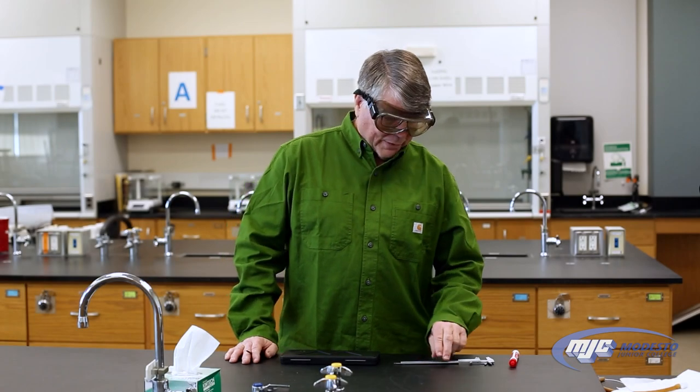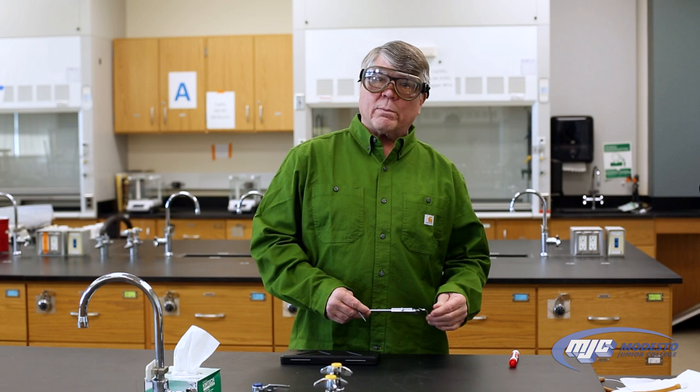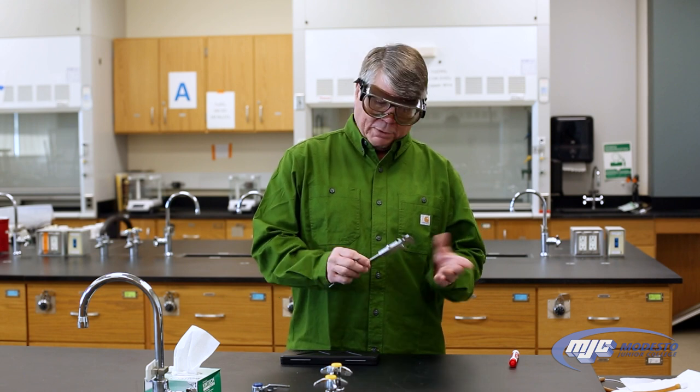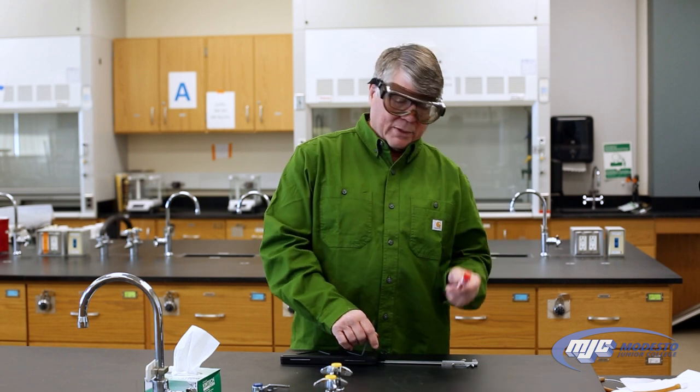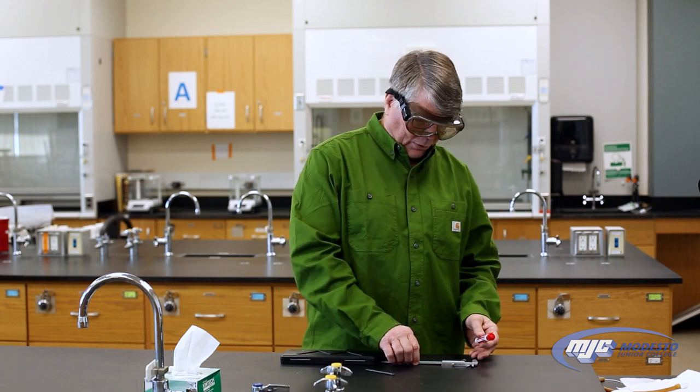Hey guys, this is an explanation of how to use a set of vernier calipers to measure something. So let's say we're going to measure the diameter of this expo marker.